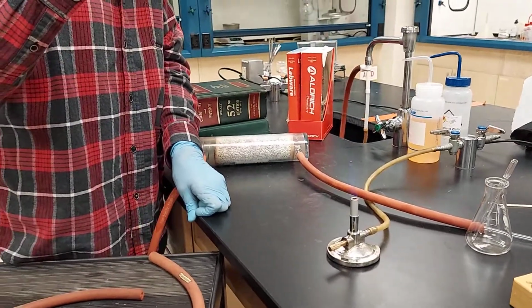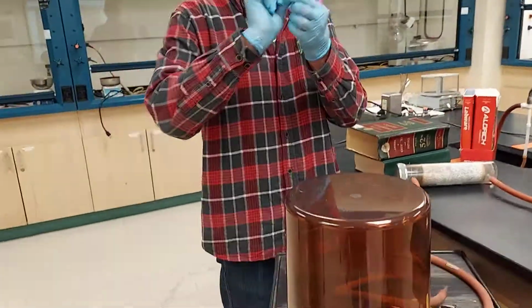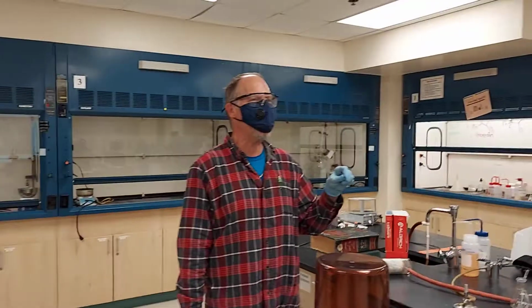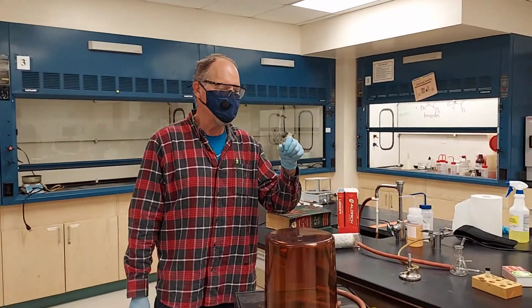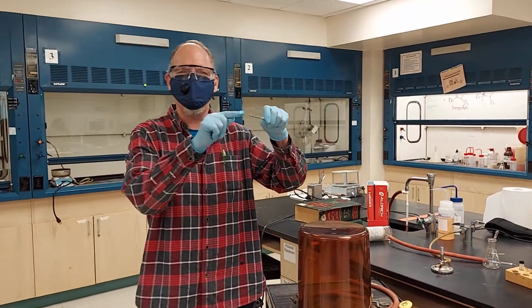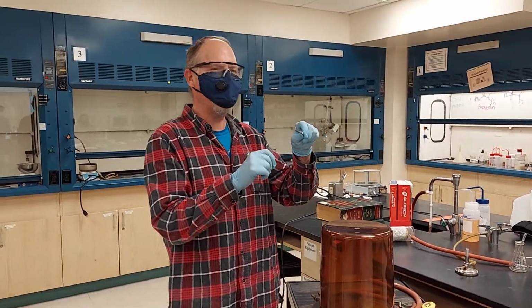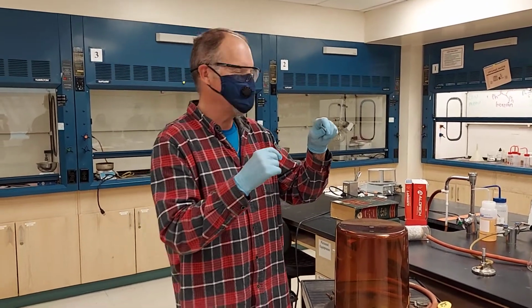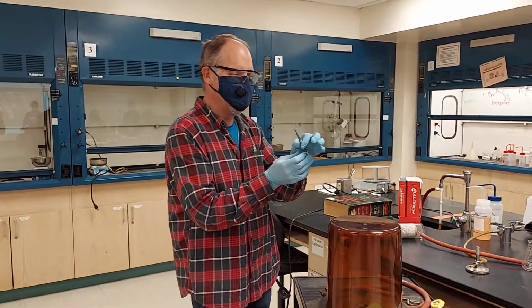But I created a nightmare. That smoke is burning caffeine. This video is becoming more entertaining than originally anticipated. What happened was my seal broke here with the pressure I created, and the caffeine left, and it's not sealed anymore. We're going to pretend it is because this is a demo anyway.